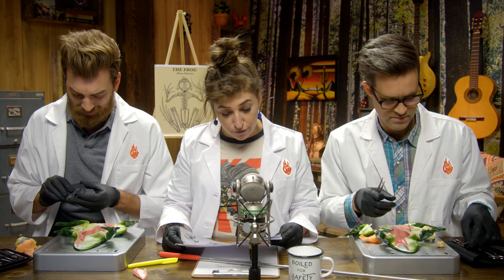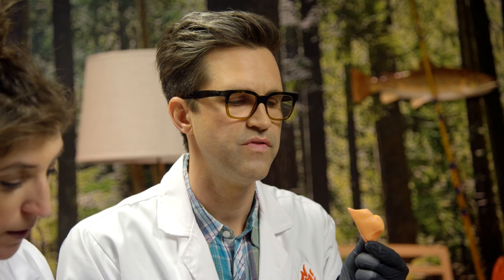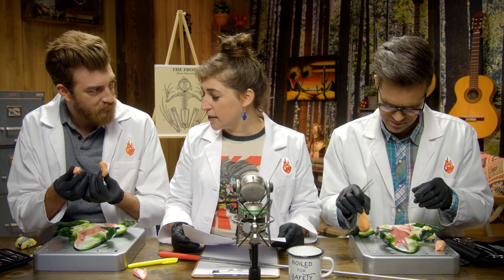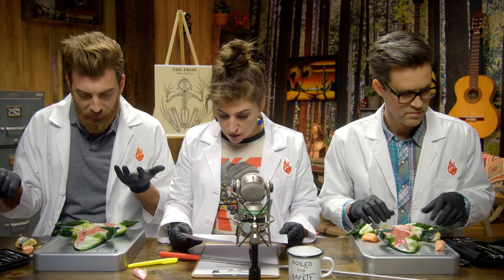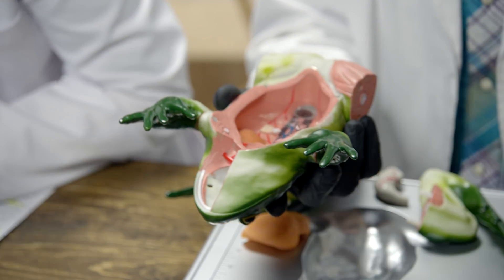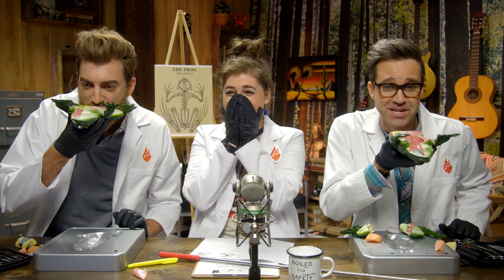The remaining two removable parts are fat bodies — this is extra fat that they accumulate, and that's also one of the ways you can tell between males and females because they have different fat distribution. Now that I see it in front of me I kind of want to eat it. Well I feel like we've created a bowl — it's like a soup bowl. Just kind of get your water and then right out the cloaca. It's not a real cloaca, it's not functional.